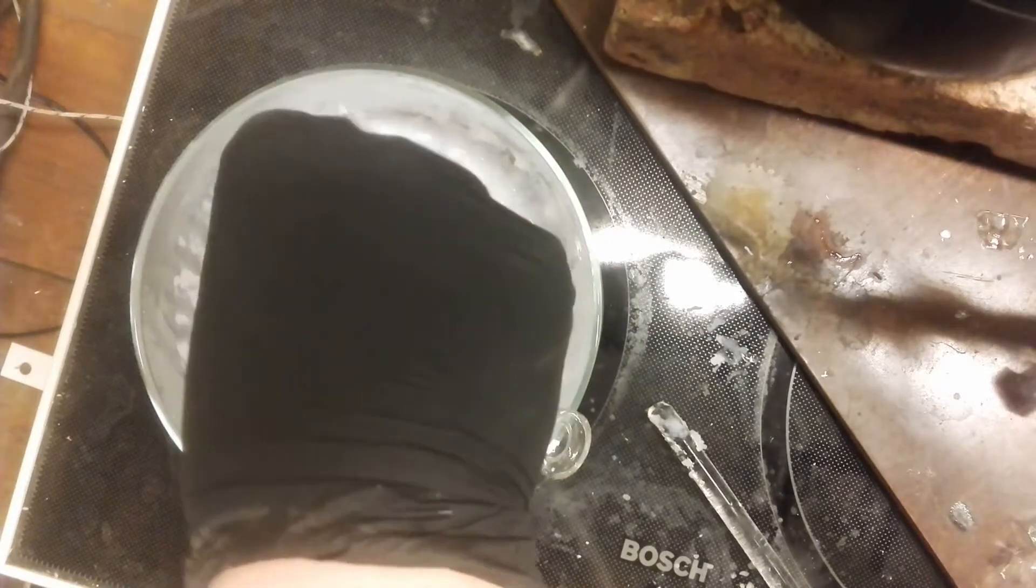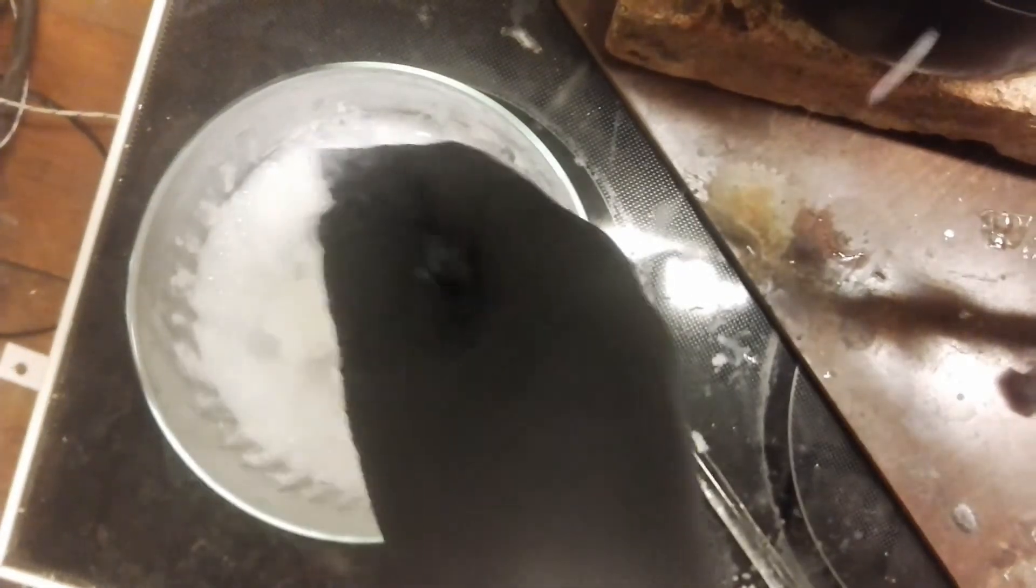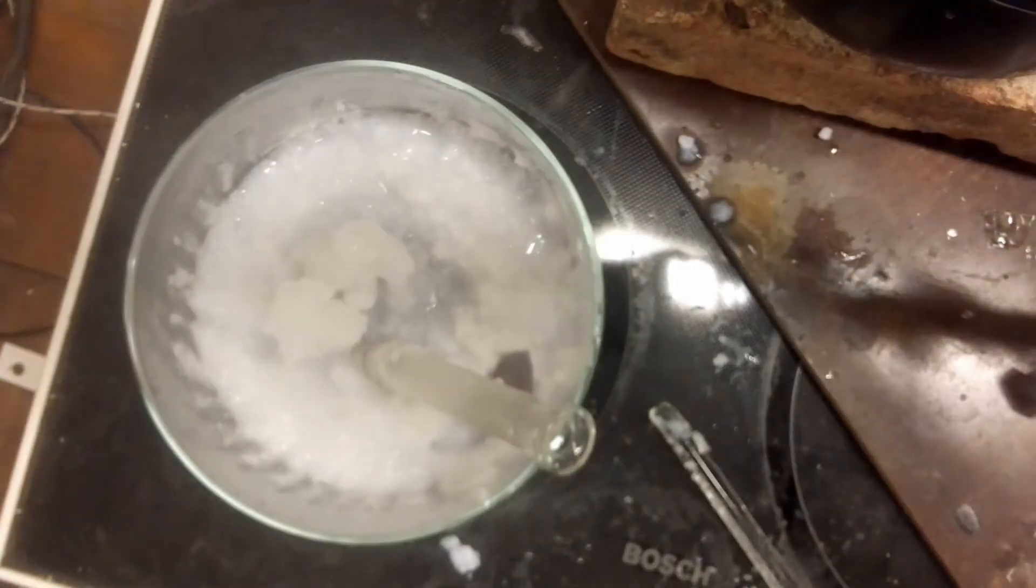We tried to dry it on a hot plate in a dish. It splattered like crazy and made a nice mess. You need some strong sodium hydroxide solution to clean it up. No solvent will work.